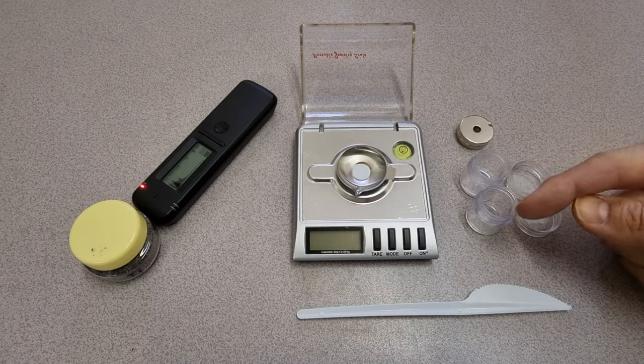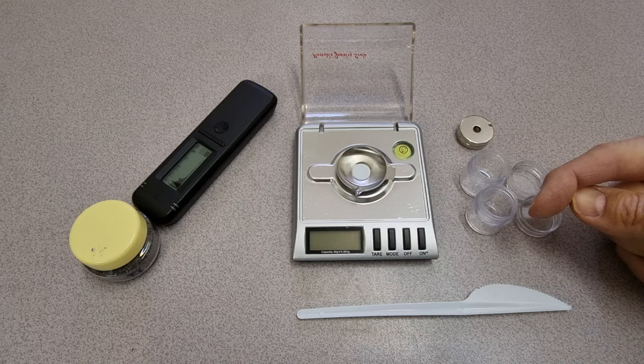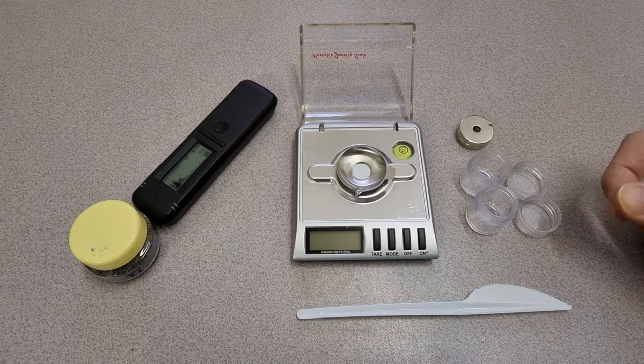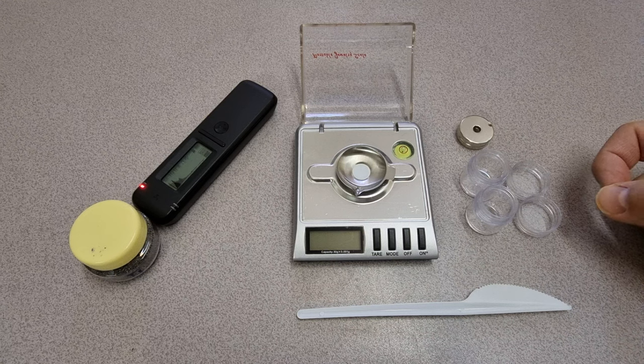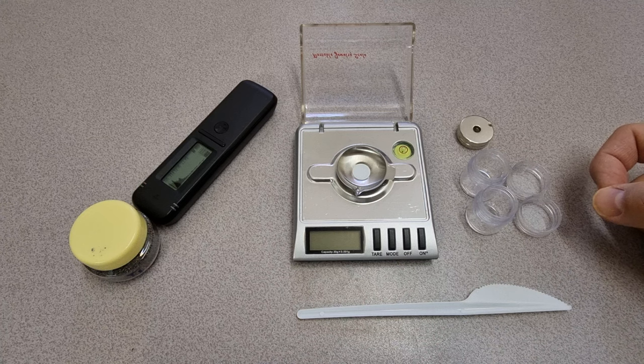I've got a couple of sample jars here and what I'm going to do is measure some because I'm hoping to throw this on an SEM tomorrow and see if we can confirm the elements in there.